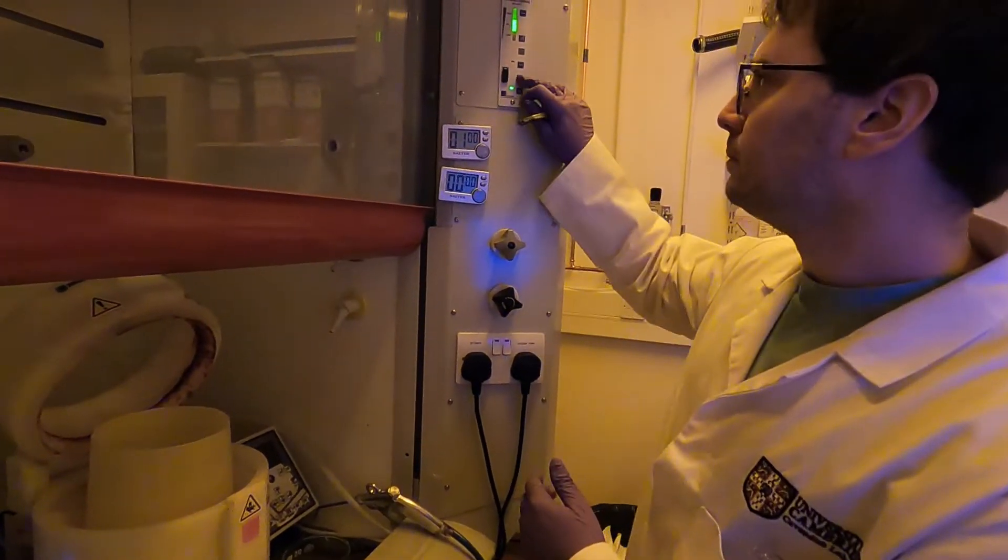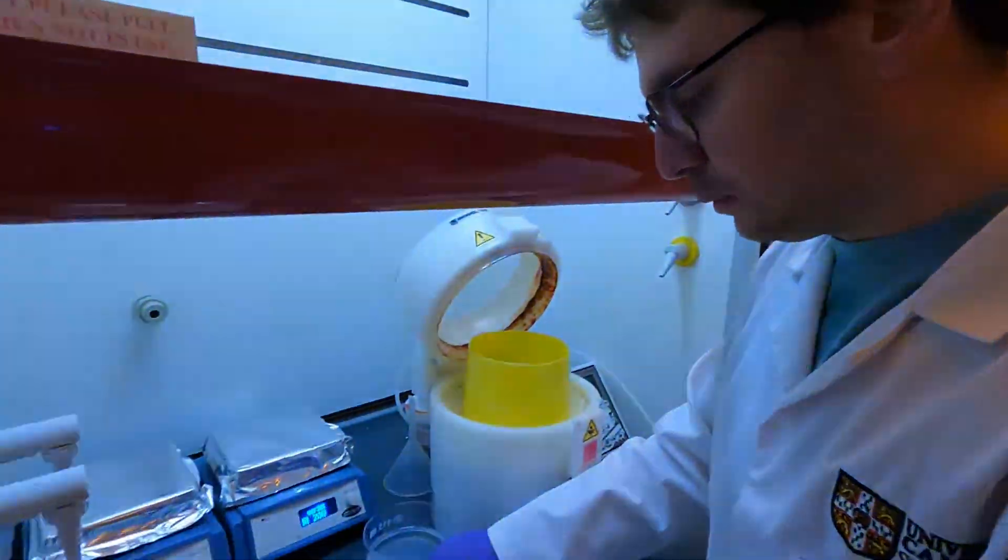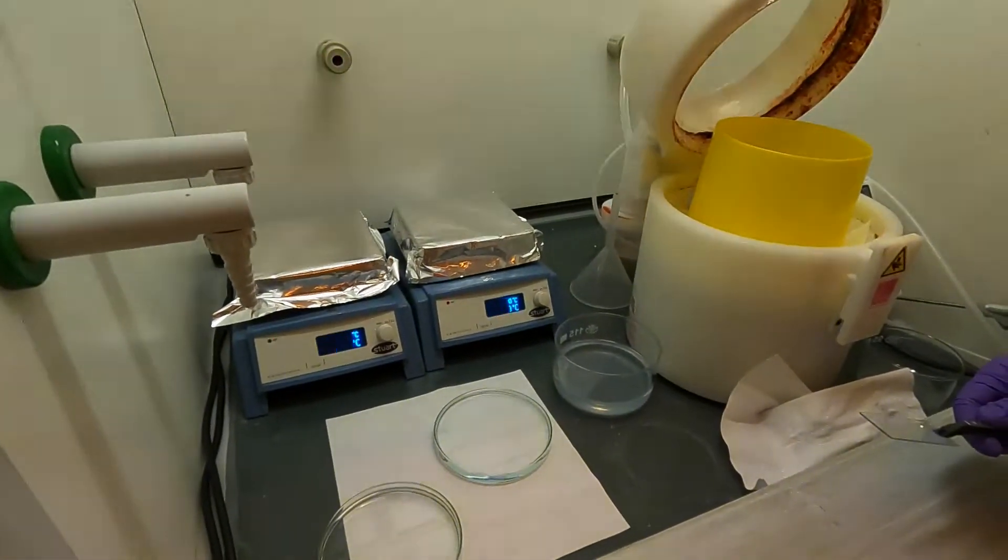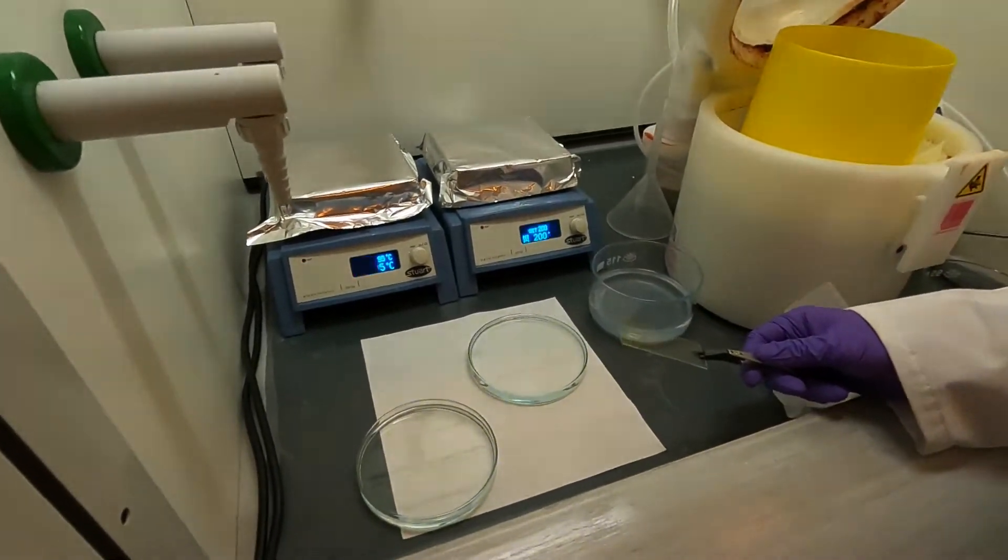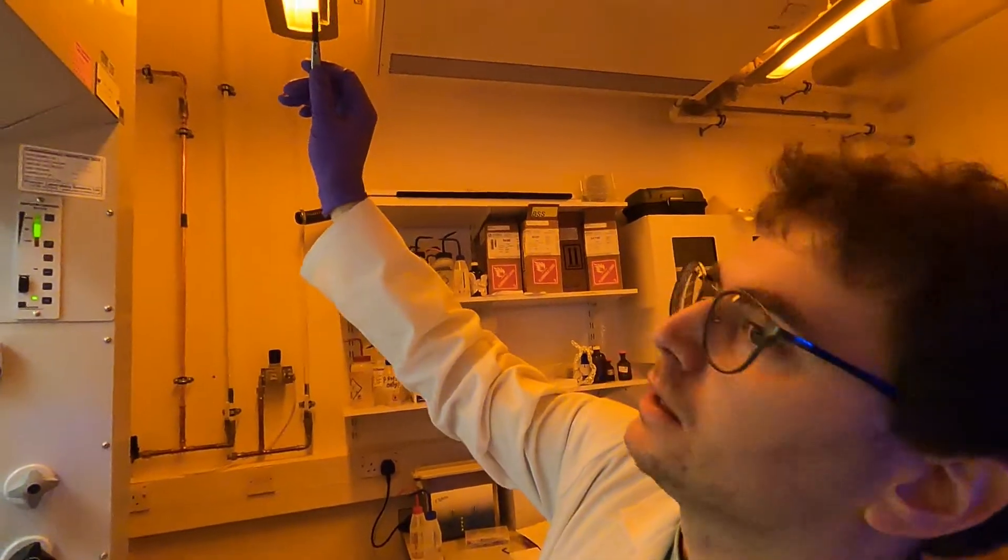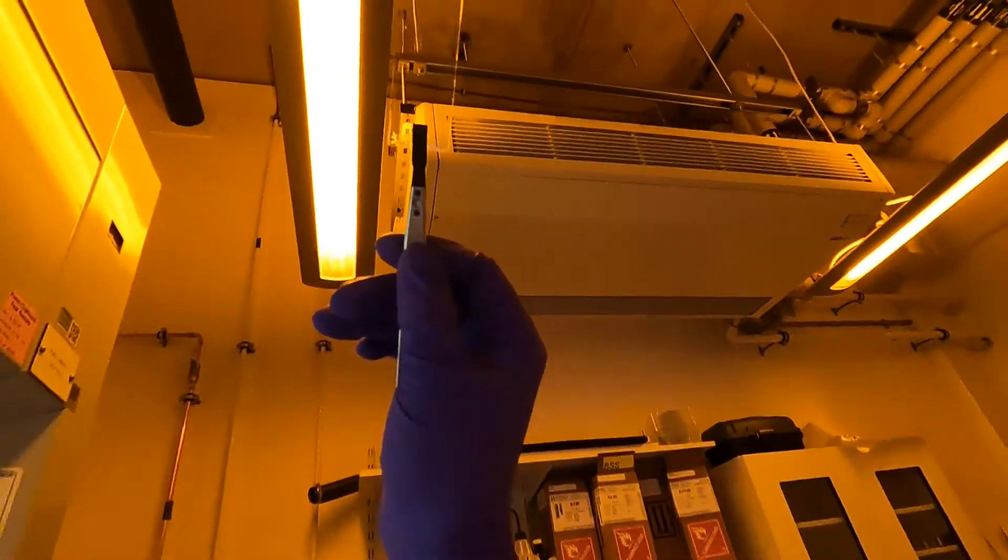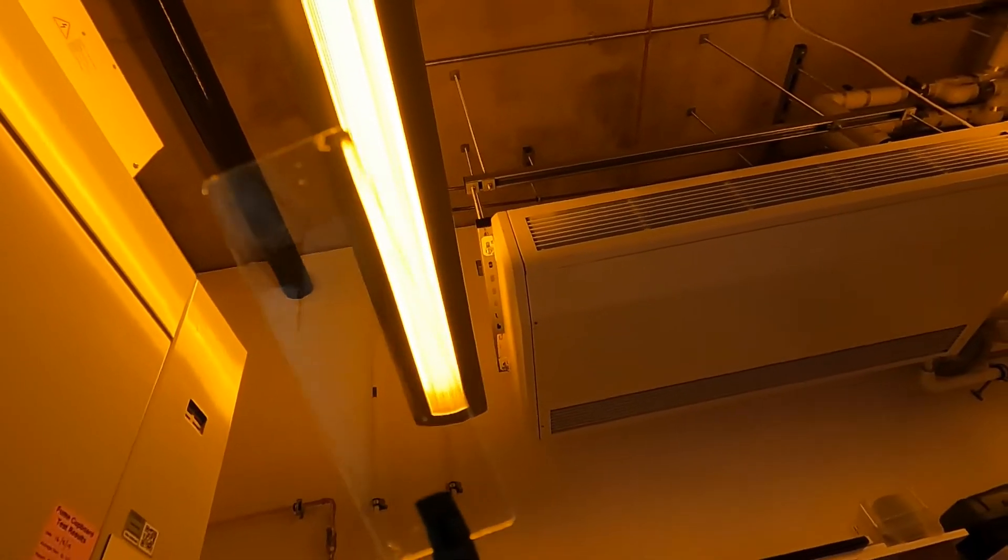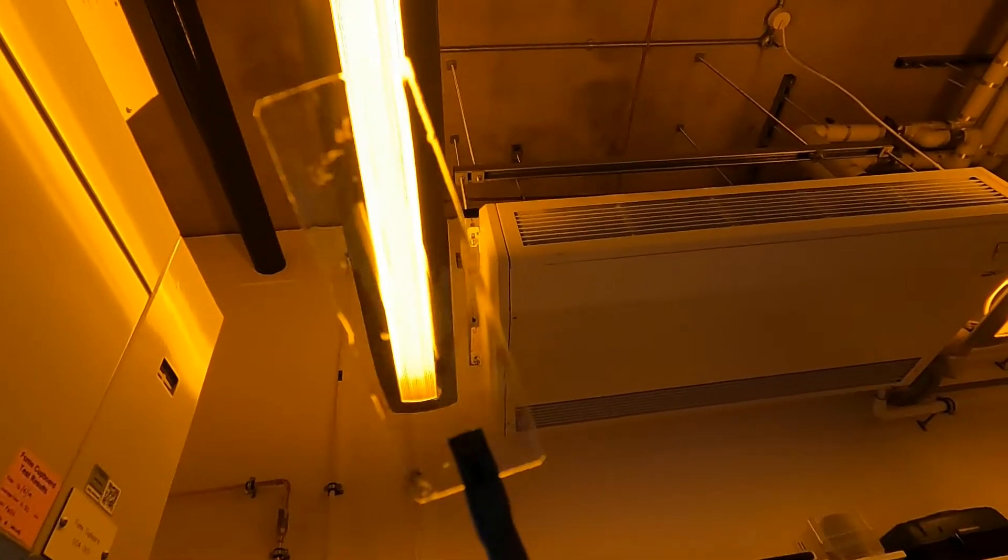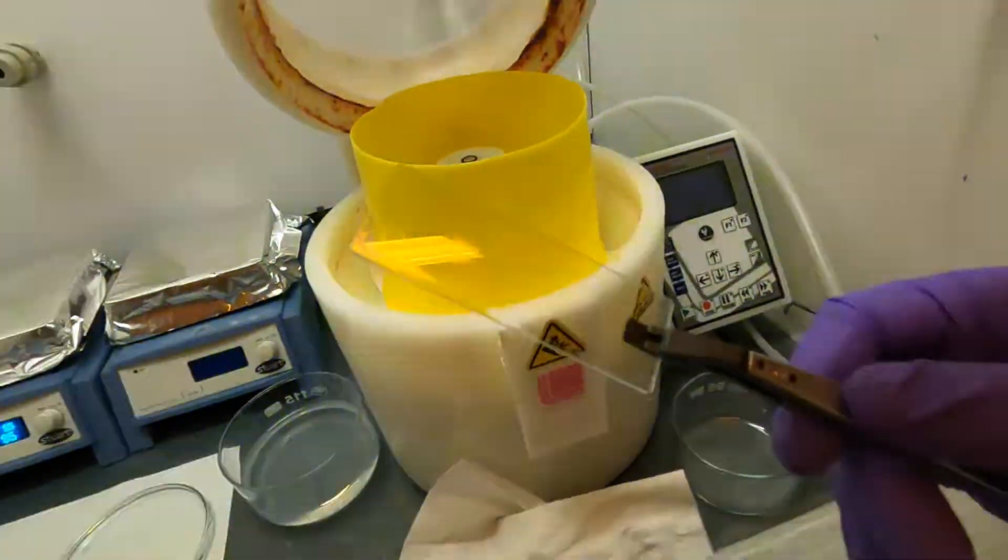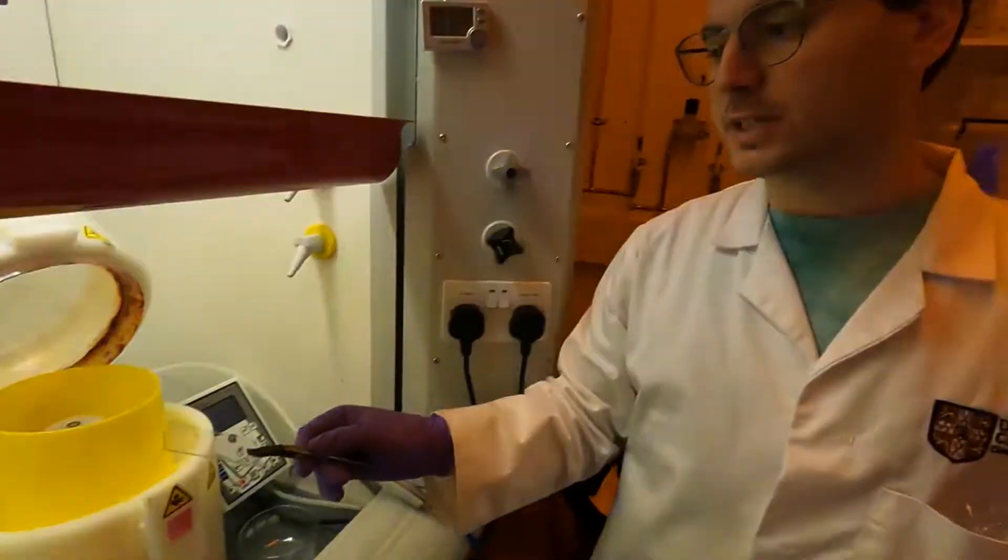I'm aiming for this particular structure. At this particular stage, after the post-exposure bake, you should be able to see the structures. At this point you can see the contrast between the exposed and unexposed parts of the sample. There will be contrast on the edge, but the film is all still there, so there are no structural features yet on the sample itself.